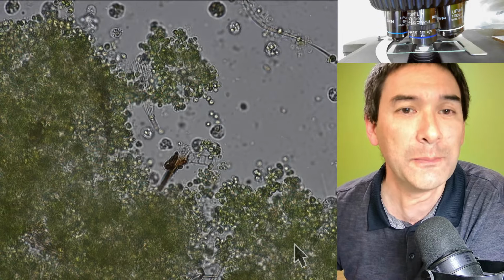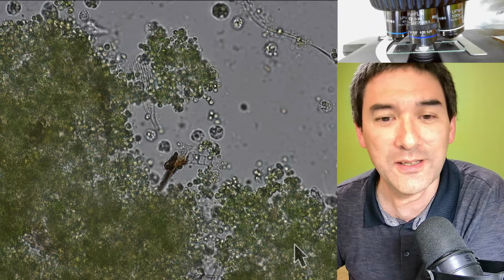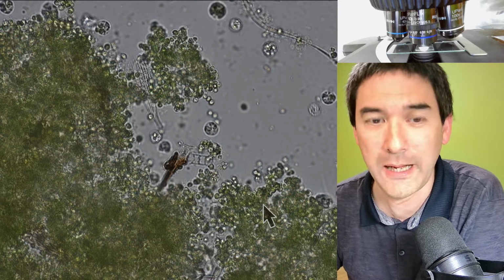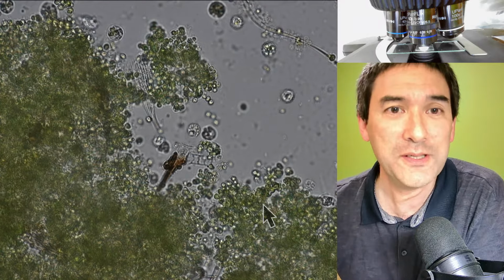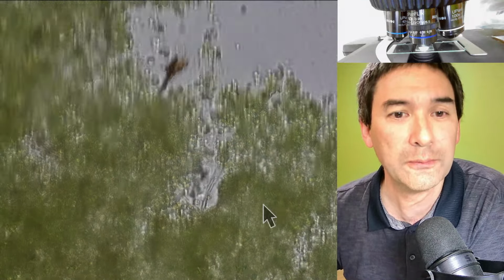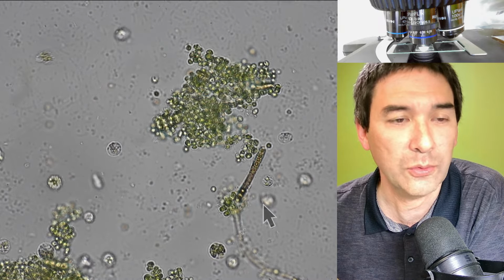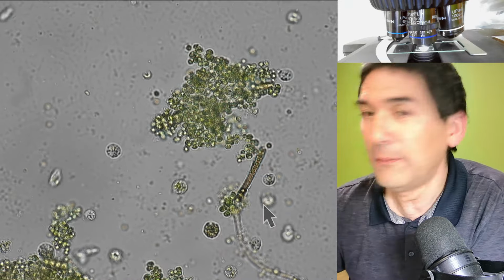Look at this. I must have messed up something. Maybe I did not wash the petri dish properly. Look, do you actually see this here? There's the scale of a butterfly over here. My bad. I don't know, doesn't matter. This basically means that we have a few more interesting things to observe here. Now look at this. I'm a little bit baffled right now. Okay, so check up here.